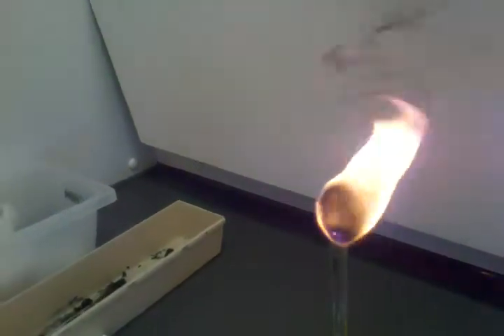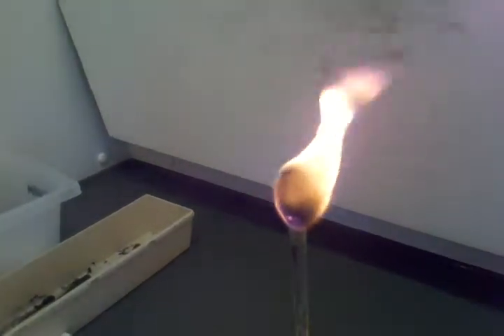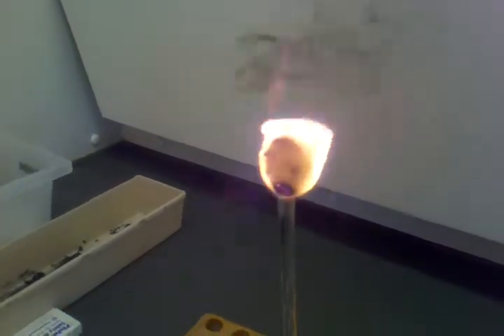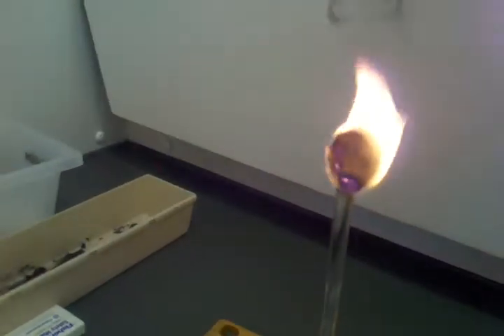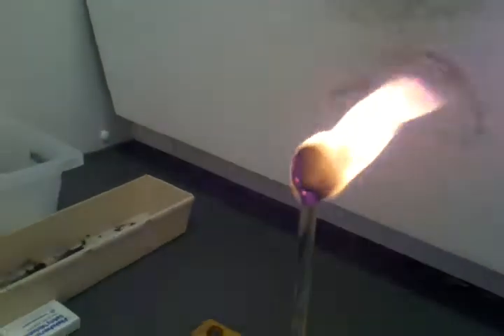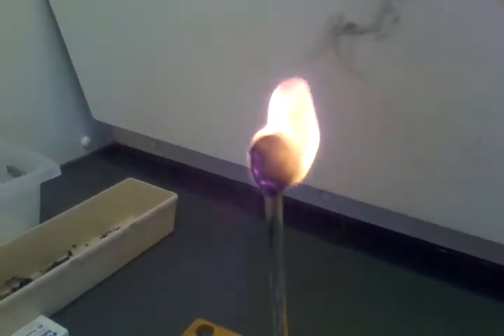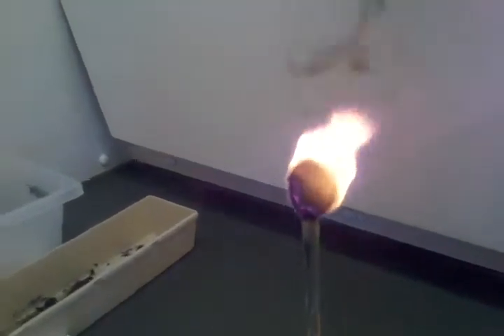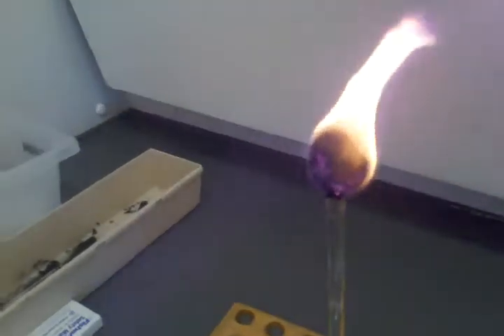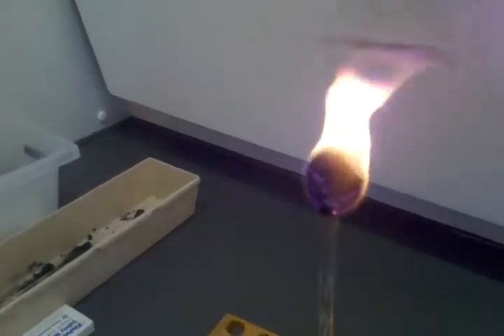Two minutes. It's a very strong one. This one looks like a brownie. They have pink — they're hot pink. Hot pink molecules. I like it! What do you think it looks like? It's got pink. This is burning, huh? Yeah. It's like shrinking. It's mostly the cotton that's running out, I think. It starts ripping from it.